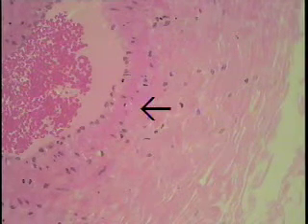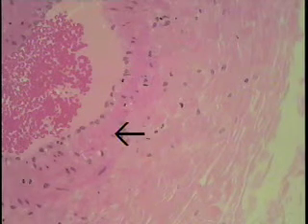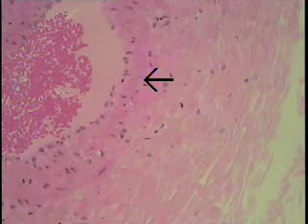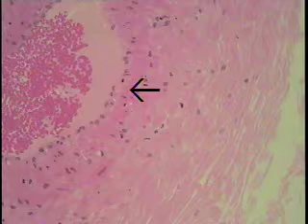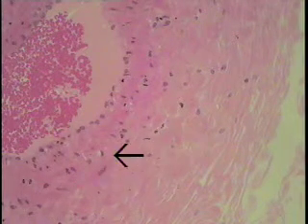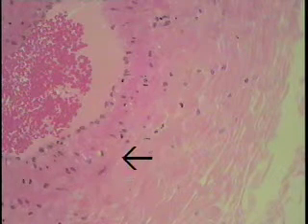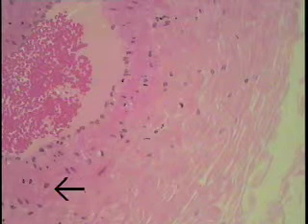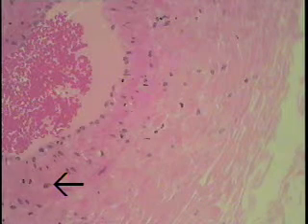This layer here, the next layer visible, is the tunica media, and it's made up of smooth muscle cells, maybe 3 or 4 layers, running at slightly different angles. They don't have that nice tight spiral as the arterial side does. Here you can see individual smooth muscle cells spiraling out into the connective tissue. The cytoplasmic boundary is shown here on this spindle-shaped cell, and this is its nucleus. Another smooth muscle cell nucleus is shown here, also spindle-shaped.